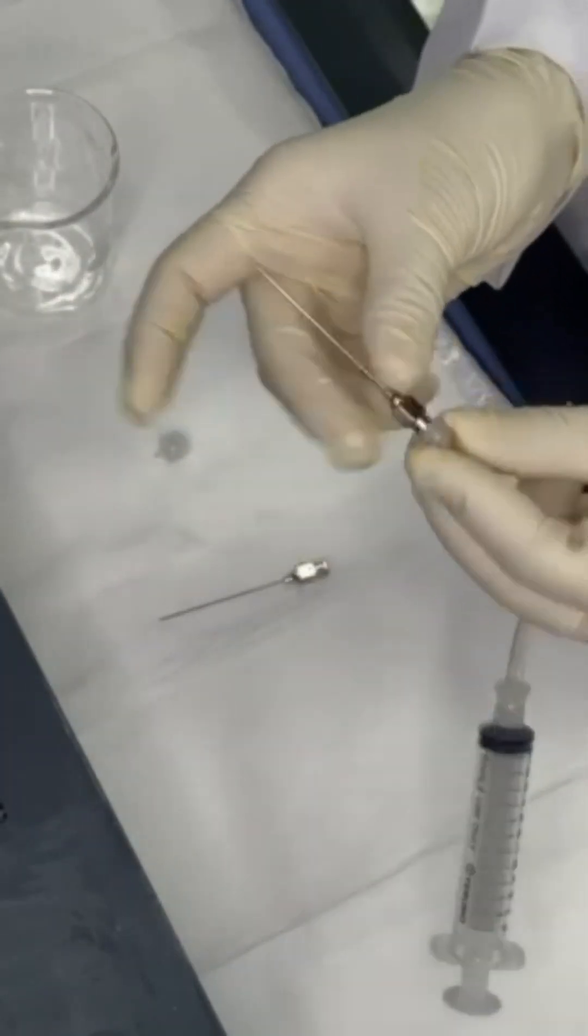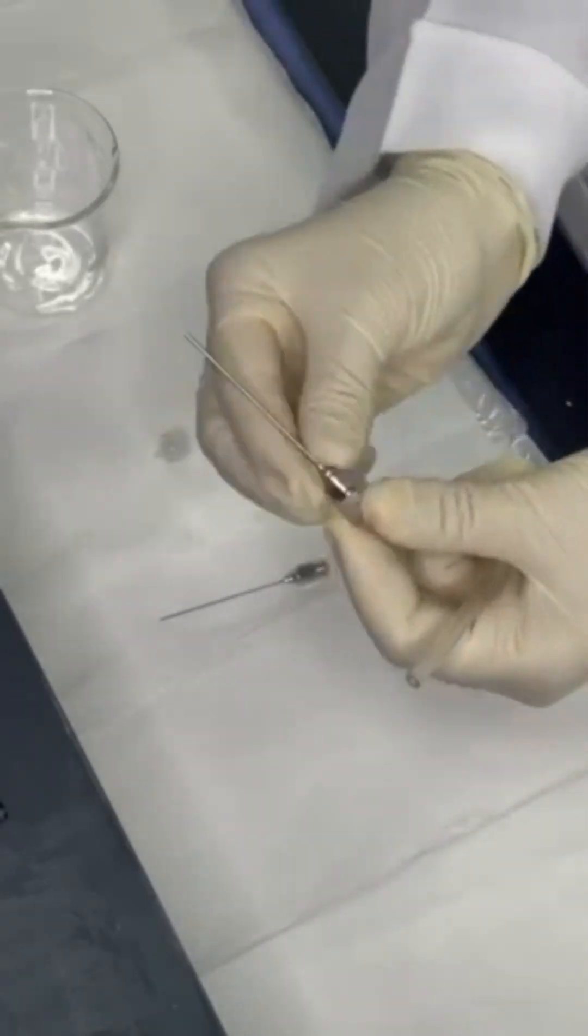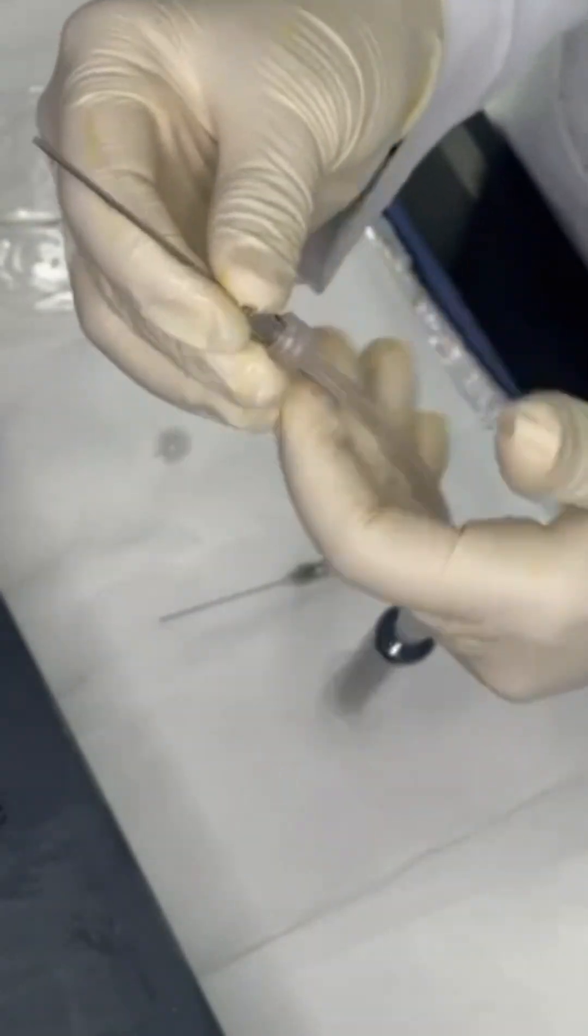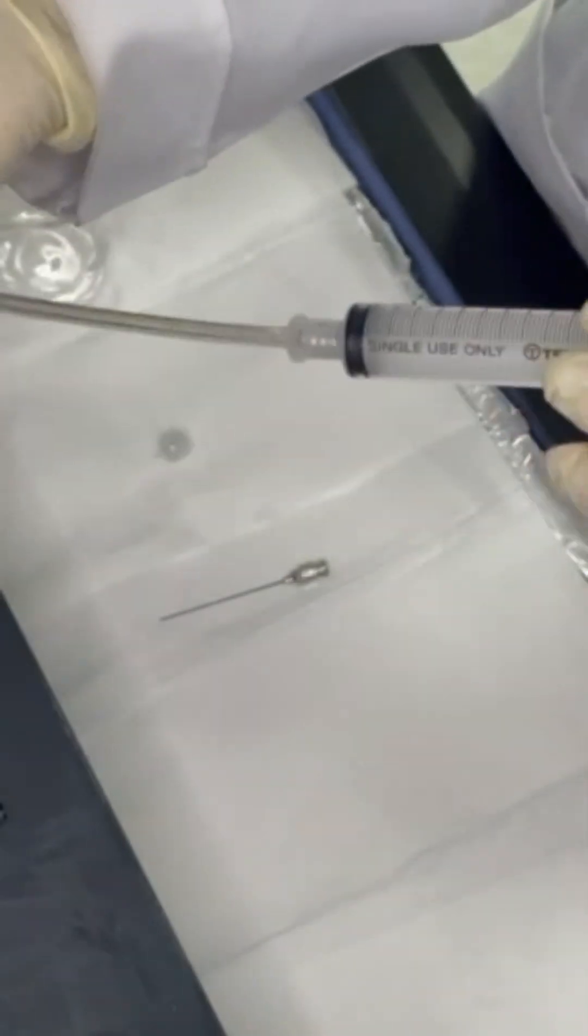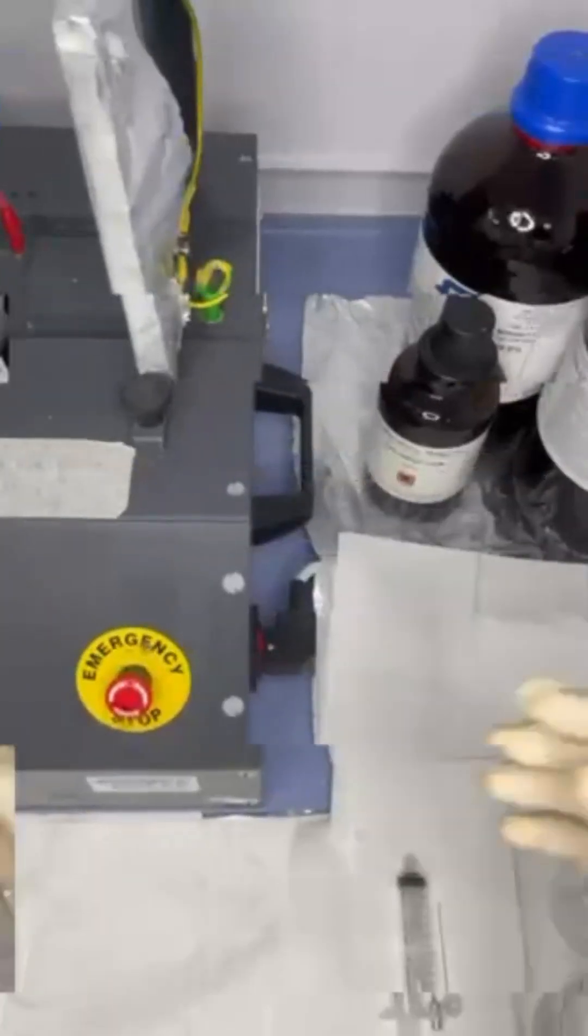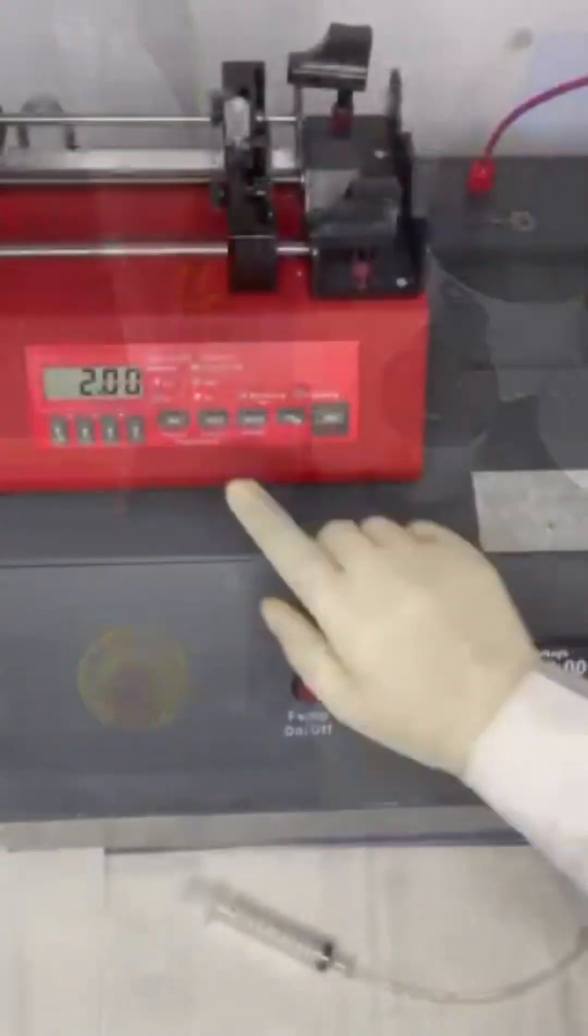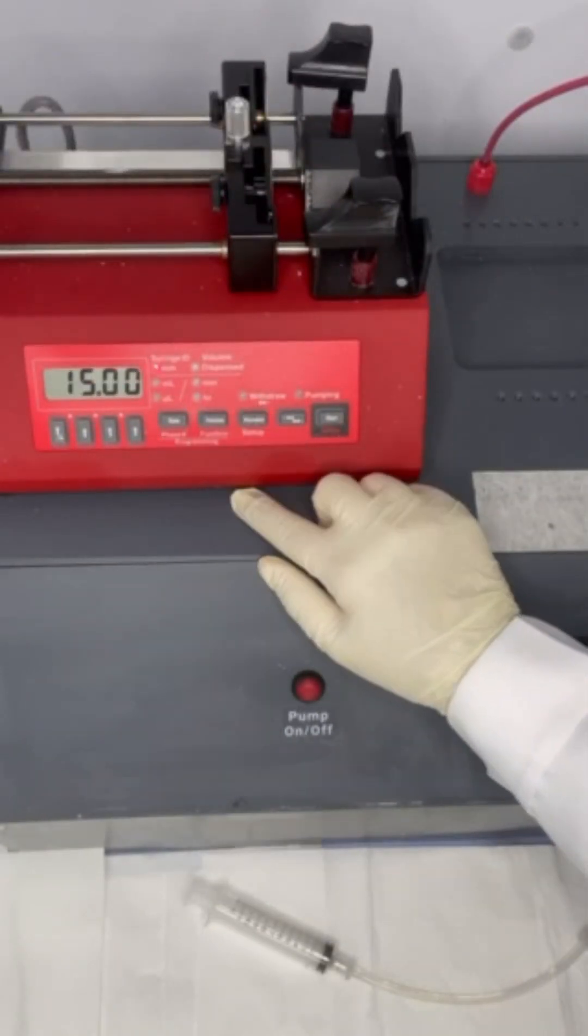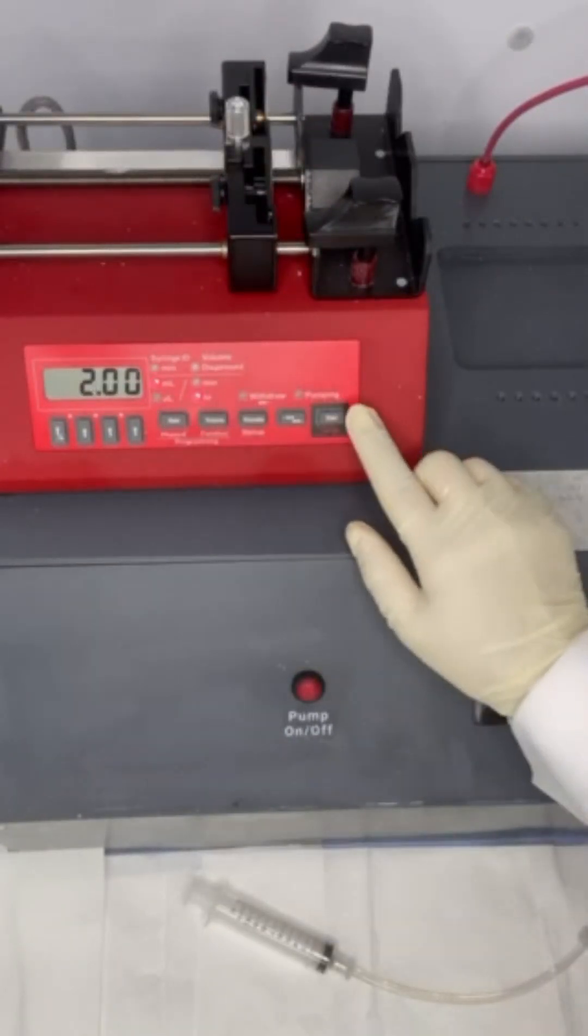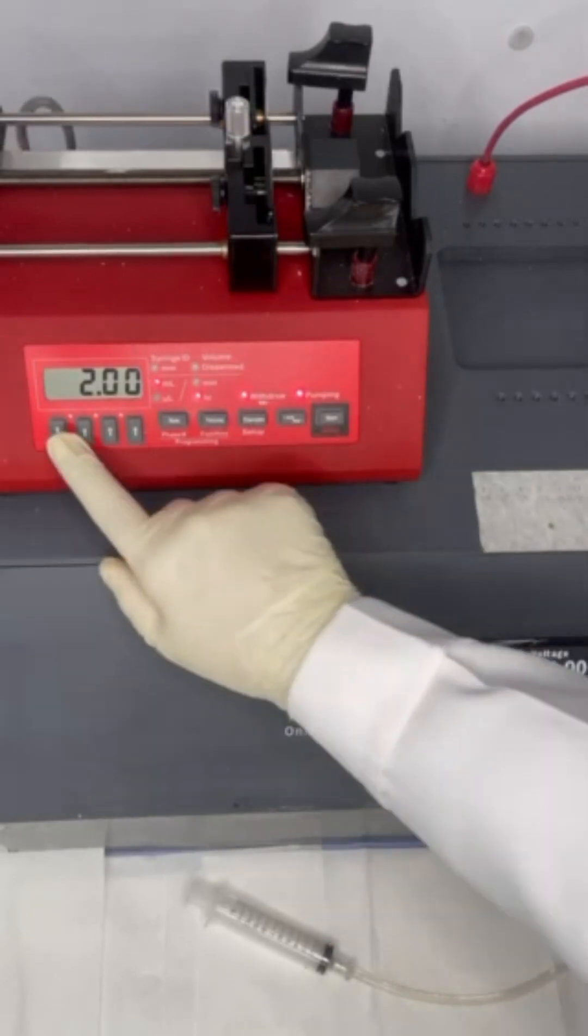We prepare the needle and make sure it is ready for use. Turn it on, check the parameters, and move the needle holder back.